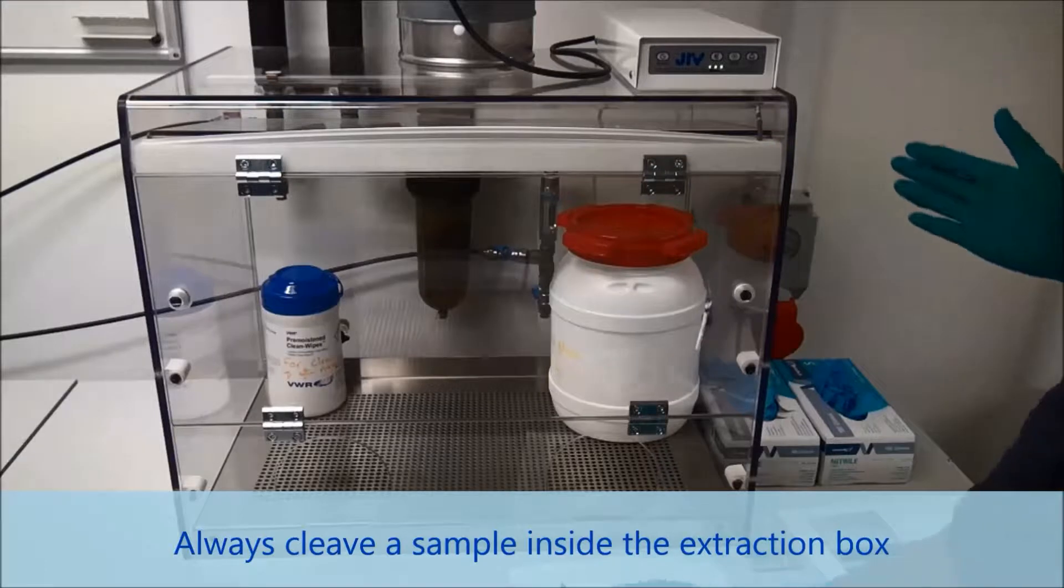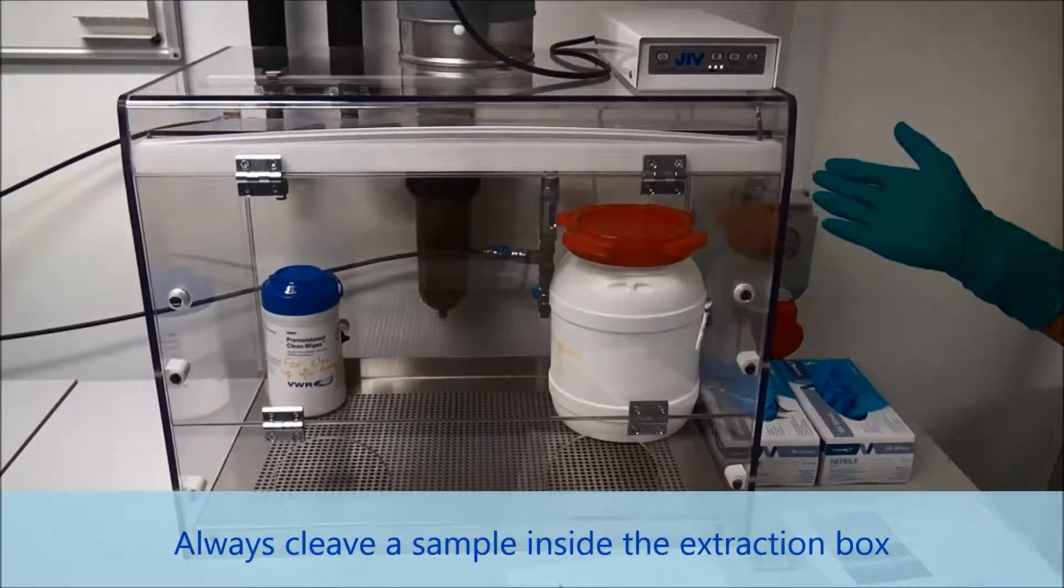In order to cleave the wafer, I have to use the extraction box here.